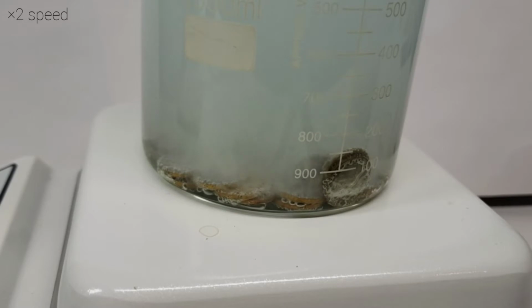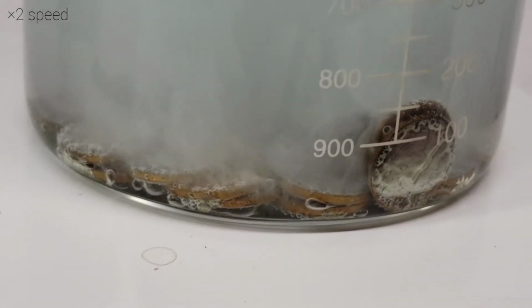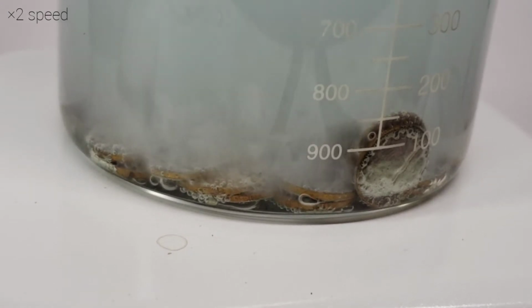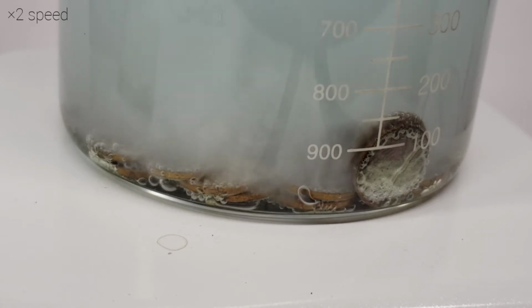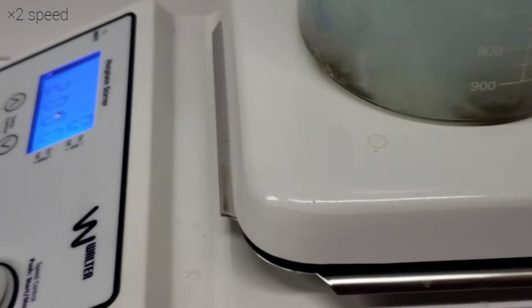And while watching this bubble away a bit, I'll take a bit of time to say what's actually happening in this reaction that you're seeing. So as the reaction goes, you start out with just two atoms of copper, which react with four molecules of acetic acid and four molecules of hydrogen peroxide. And that then produces two molecules of copper(II) acetate, six molecules of water, and an O2 molecule. And this reaction, of course, I'll put right up on screen.